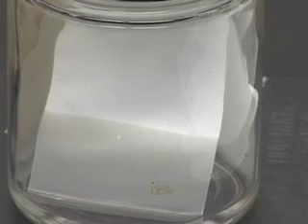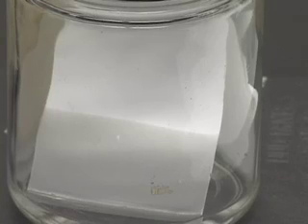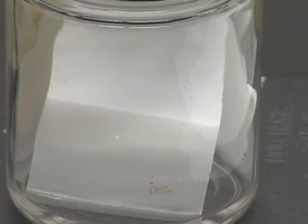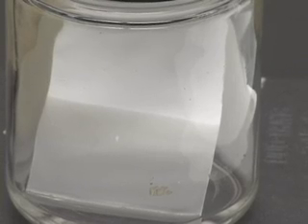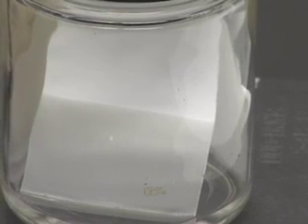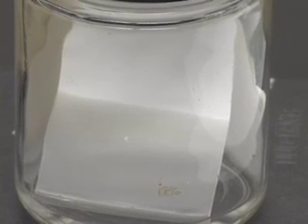Once this plate is developed, I am going to take you to a place where I have kept the UV light ready to see the spots that would appear under the UV light. Because these spots are colourless, we do not see them with the naked eye. Whereas when you hold this plate, which has a fluorescent material coated on it along with silica gel, you will be able to see the spots because these spots are obstructing the UV light being absorbed by the fluorescent material where the spots are present.